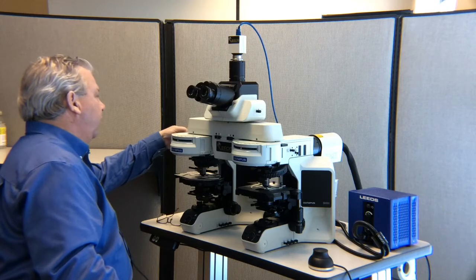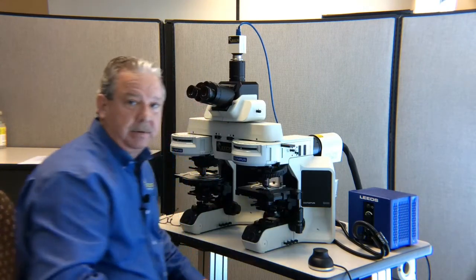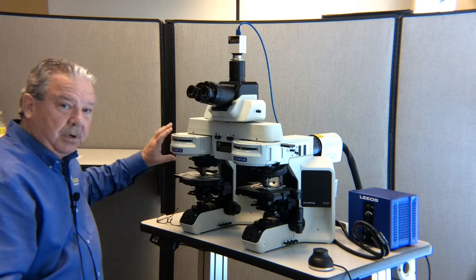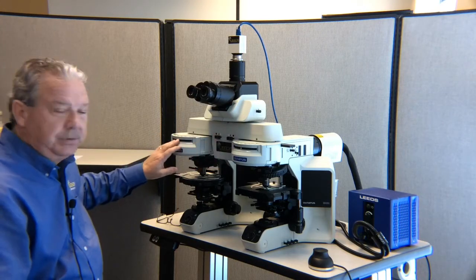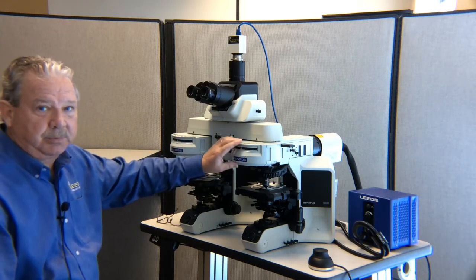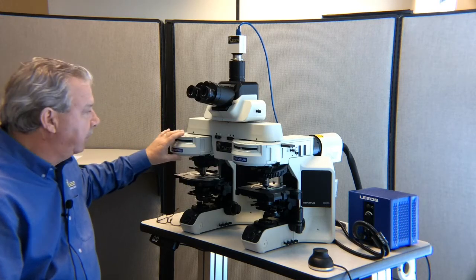The same thing with our analyzers. In this case, this microscope has polarized light, so I need to pull those analyzers out of the ray path as well. This one's also optioned with fluorescence, so we're going to want to turn to the open position in our fluorescence. In this case, the number 1 position is labeled as bright field, and so we've got none of those filters in our field of view.